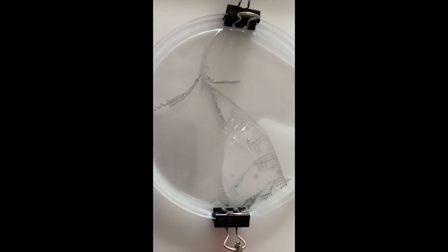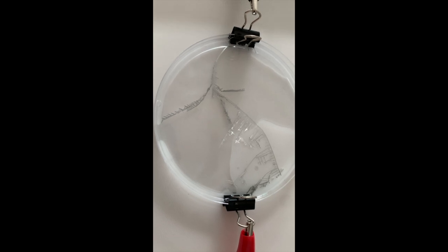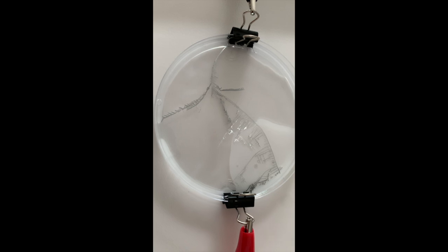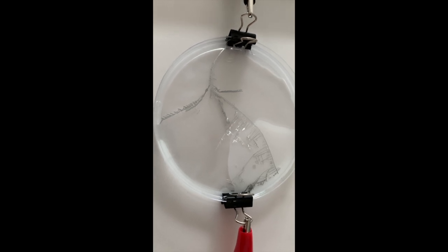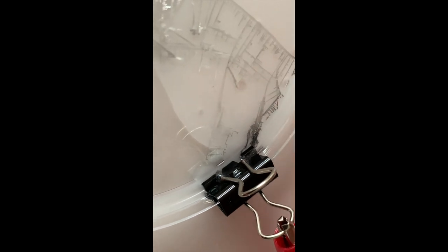The metal tree — it's amazing to watch. I wonder what causes this particular pattern. I can also observe that the metal clip has started decaying, if you look at that corner.